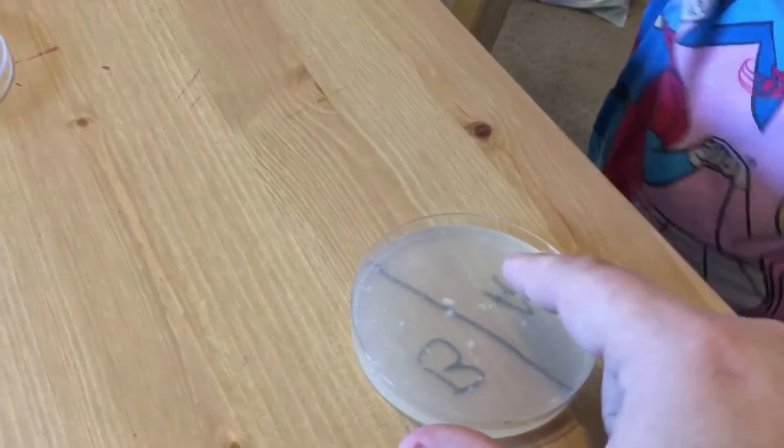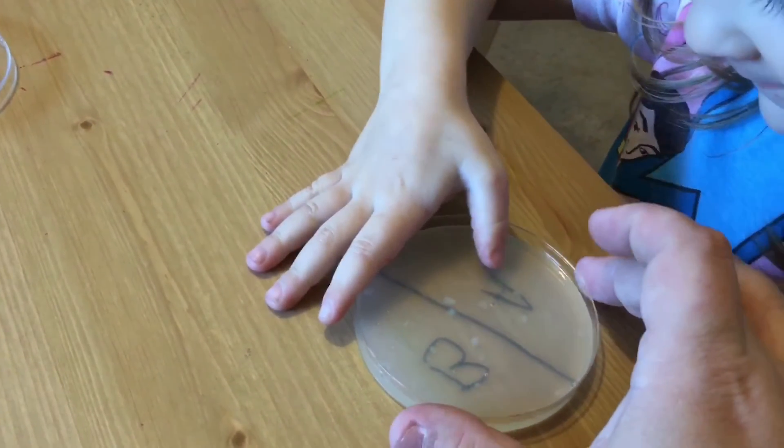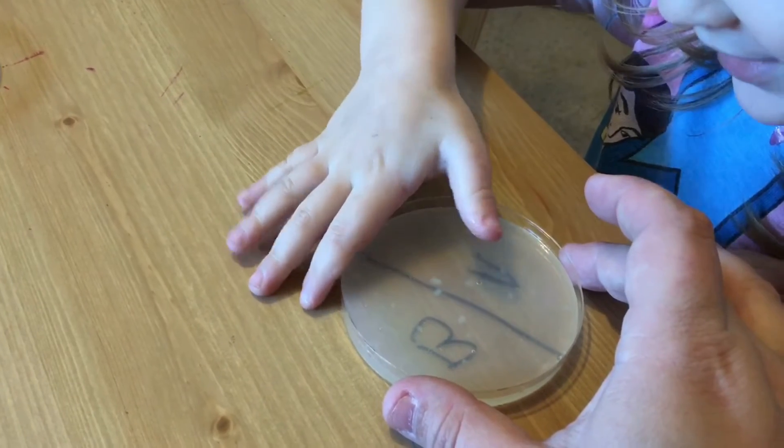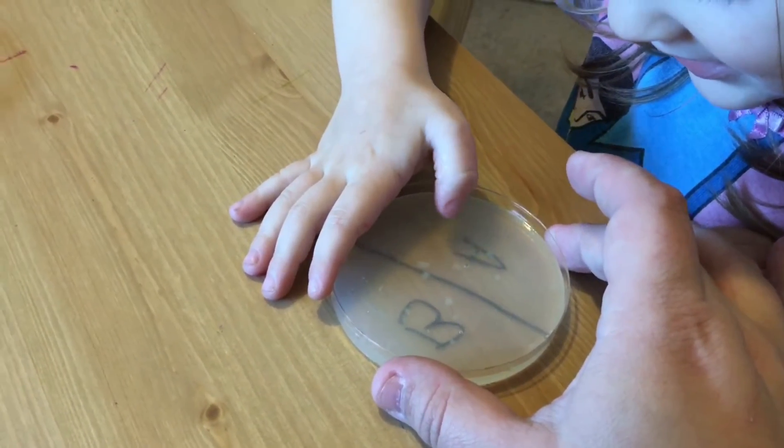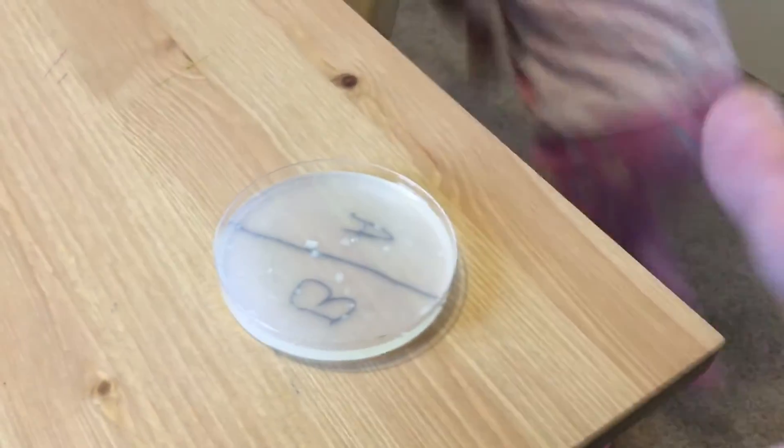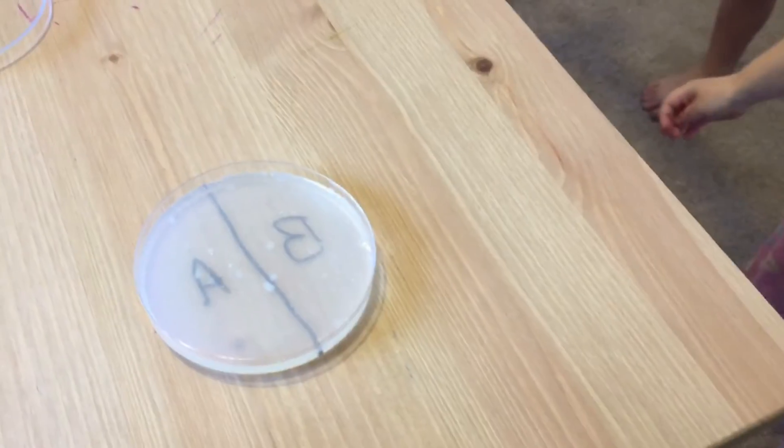That one. Okay, so we're going to gently rub it, rub it, rub it. Okay, now what you're going to go do is wash your hands.